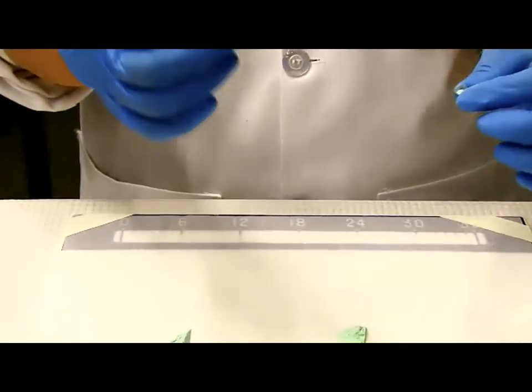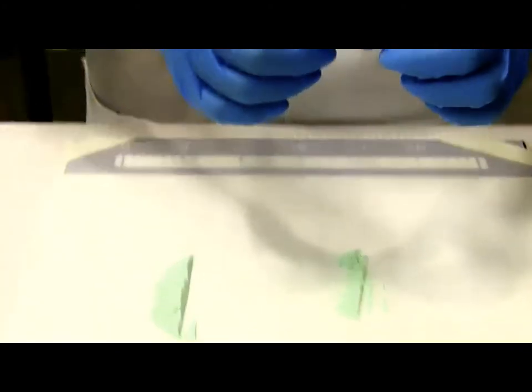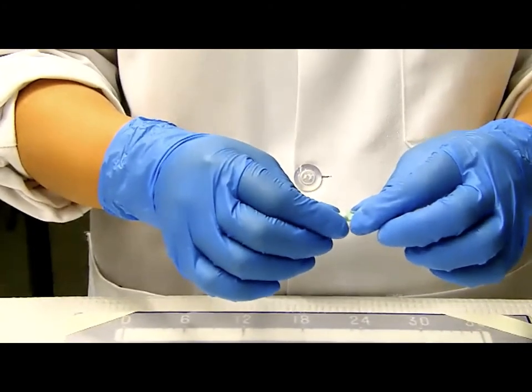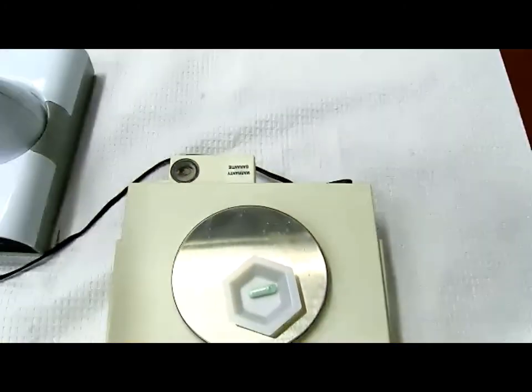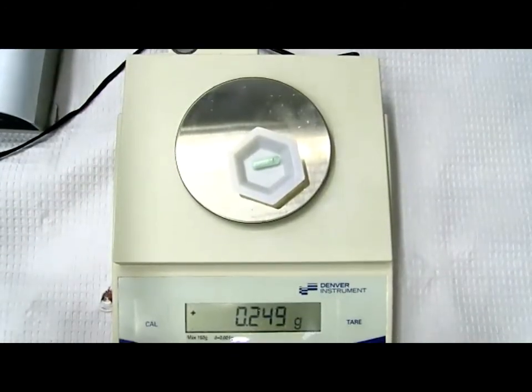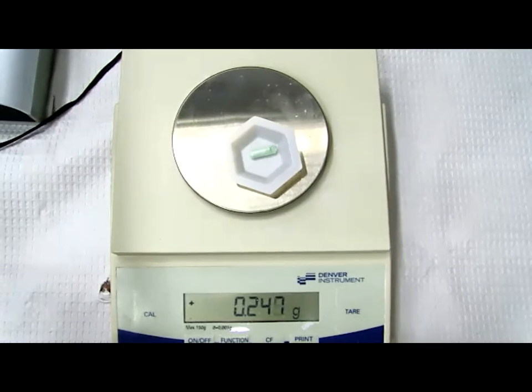Instead of using the body of the shell, we're going to use the head of the shell and just scoop a little bit of powder. Okay, and then try to see the weight. Oh my God, I'm just really good at this. He's on a roll. Again, we won't put that down as our final QA weight. She's got to do the last 2 steps and then we'll get our final weight.